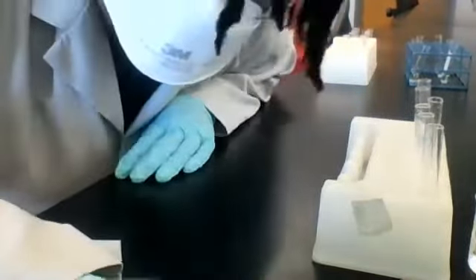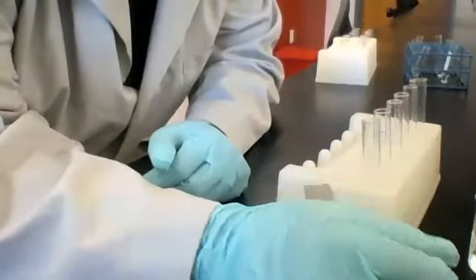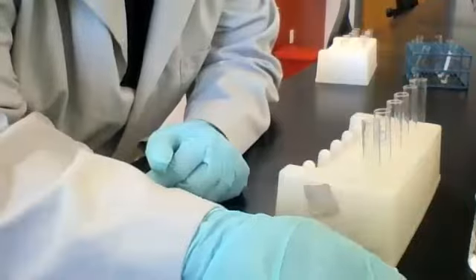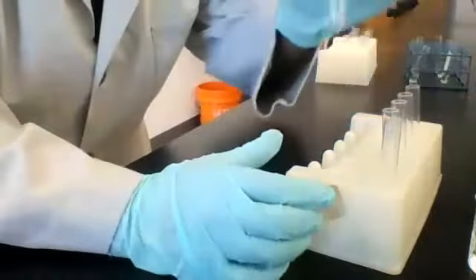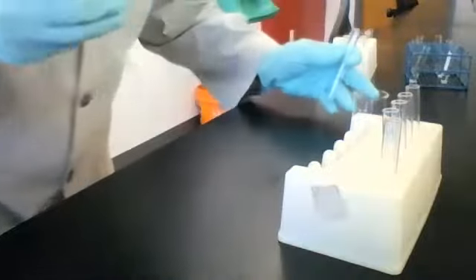All right, we're ready to go. So we're on to our third test, our third reagent, which is hydrochloric acid, HCl. So we're still on that first table in the third row, going across the third row, right? Our first test solution is sodium chloride. So let's see what happens when we add some HCl to it.